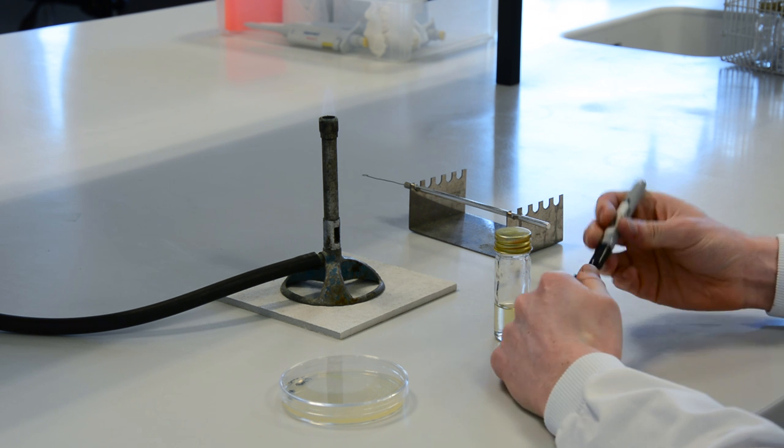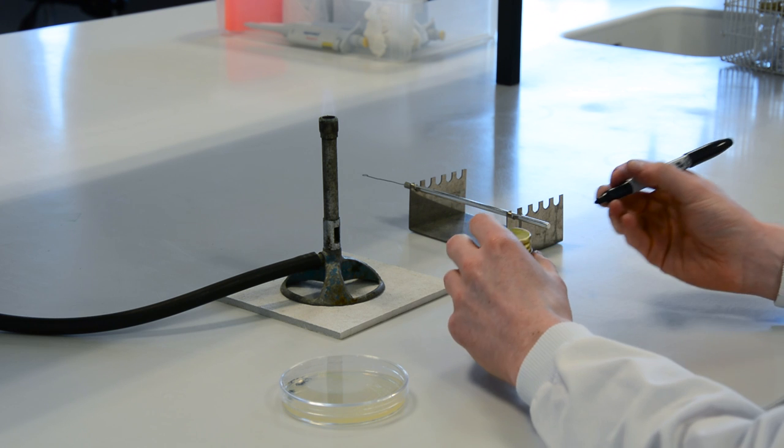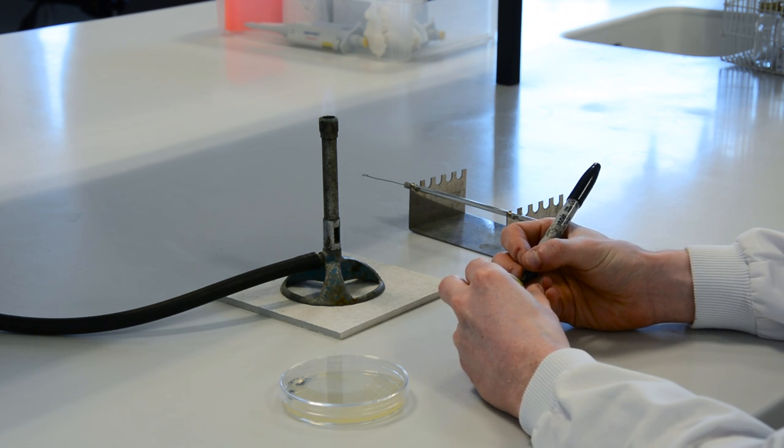As always, you should work close to the Bunsen flame and avoid putting any lids down on the bench as they might become contaminated.